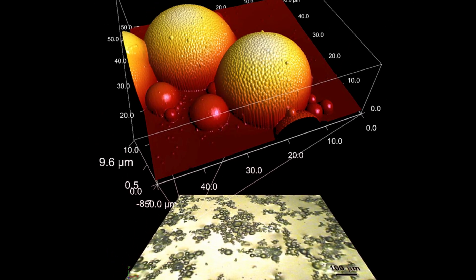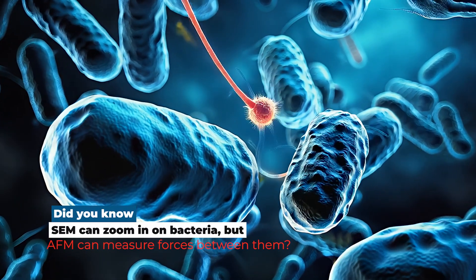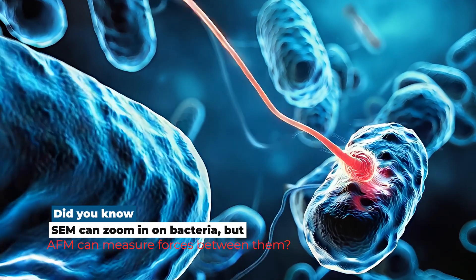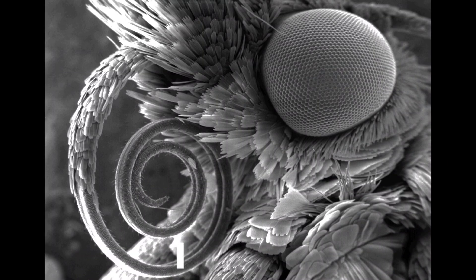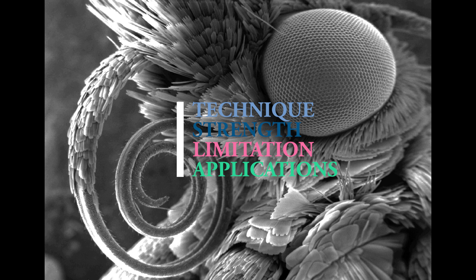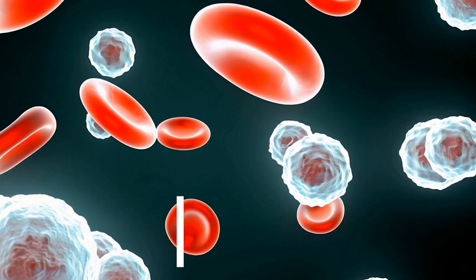Today, we settle the debate once and for all. Did you know that SEM can zoom in on individual bacteria, but AFM can actually measure the forces between them? Let's dive into the world of microscopy to explore their strengths, limitations, and surprising real-world applications.